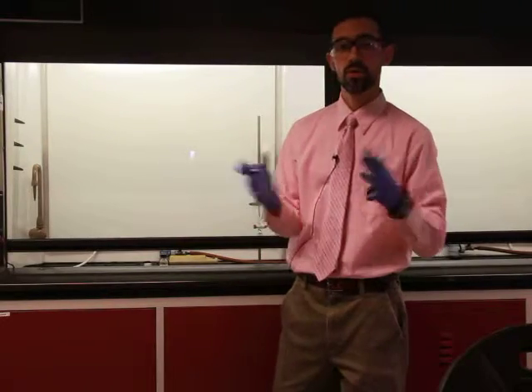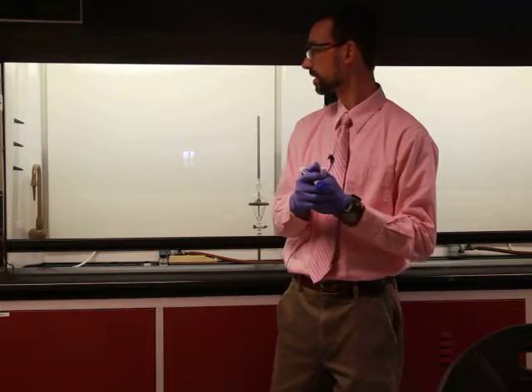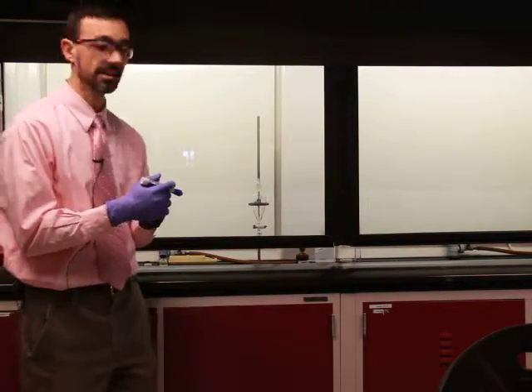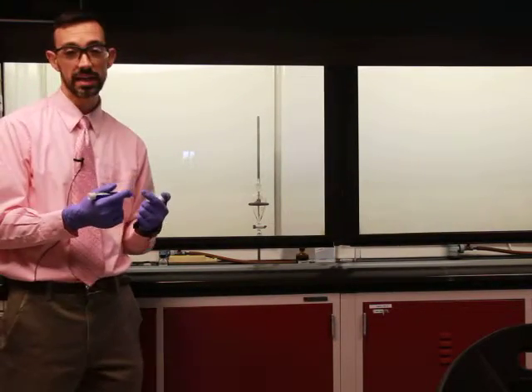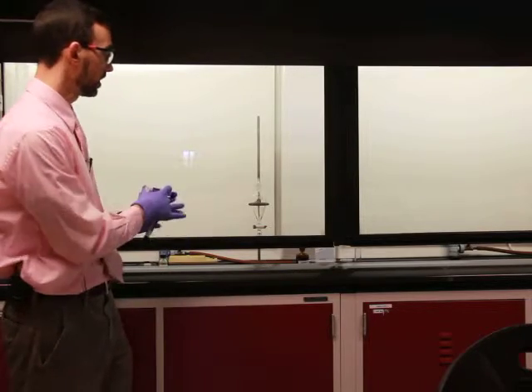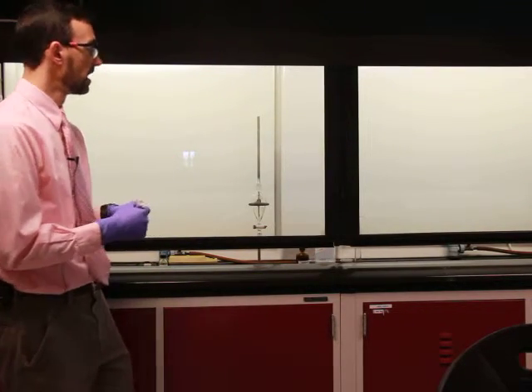Okay, welcome to our pre-lab / lab theater video where we're going to focus on the extraction technique. This is in lieu of actually performing the separation by extraction experiment. So in the hood I've got some of the materials set up and I'll walk through what this technique is.